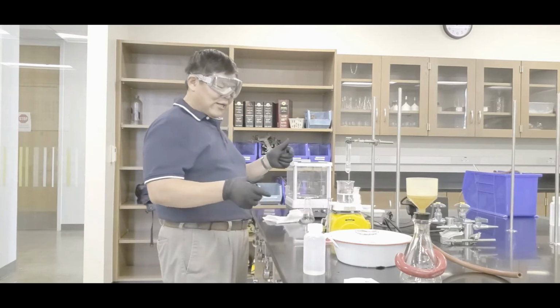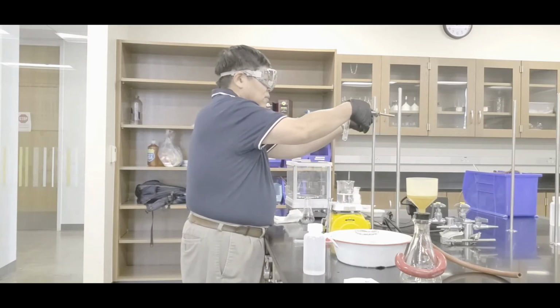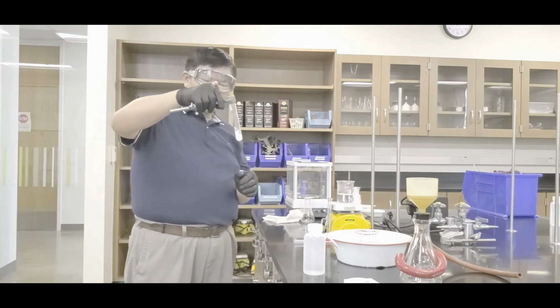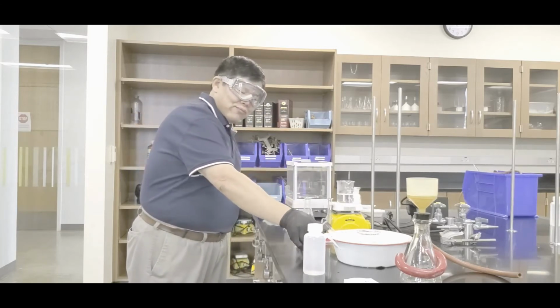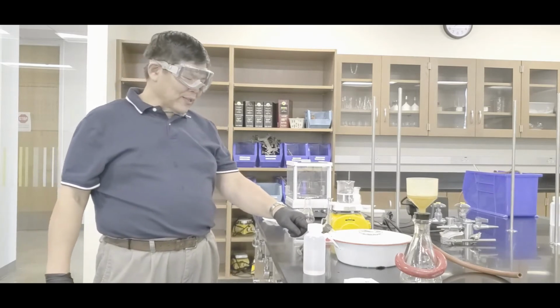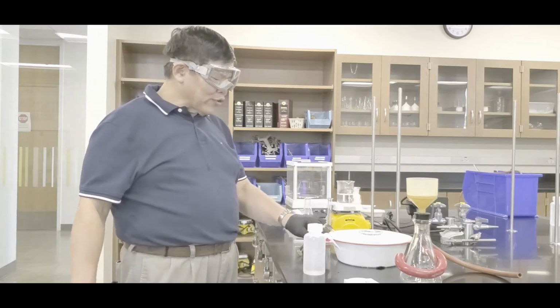Okay, next thing is this. Take the setup off. Okay, and then wag it a little bit. Ooh, it's already coming out. That's pretty good. All right, and then what you want to do is this. Park it in like that. Okay, so let the clamp be part of your holder, okay? Because some of the guys, they don't listen to me. They just stick it in the ice and it will spill over. Now I have to start the lab over.